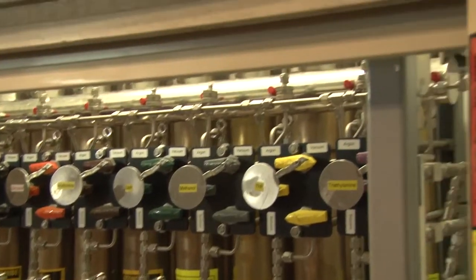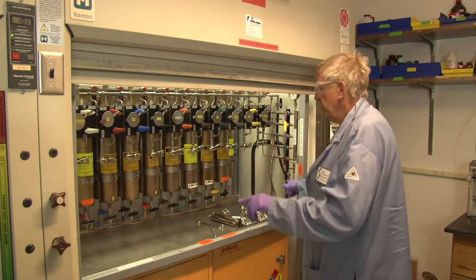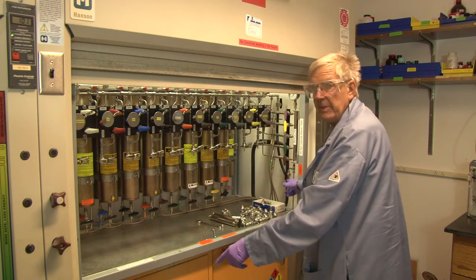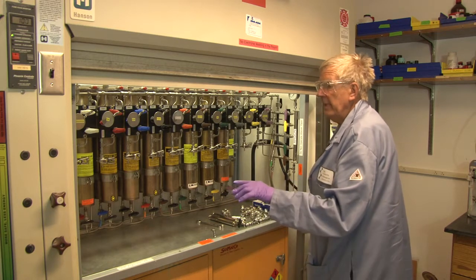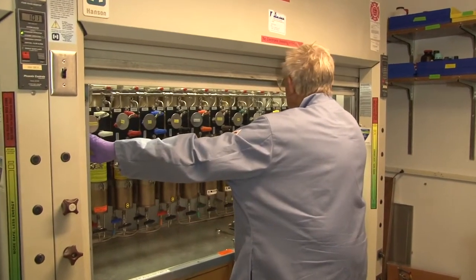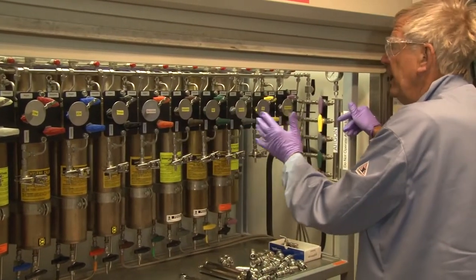There is a vacuum pump around the corner and an argon supply to the front plates and to the solvents, which will be in the cabinet here. You have a separate system for inert gas, which is here and here — this manifold operating this half, and this manifold operating that half.